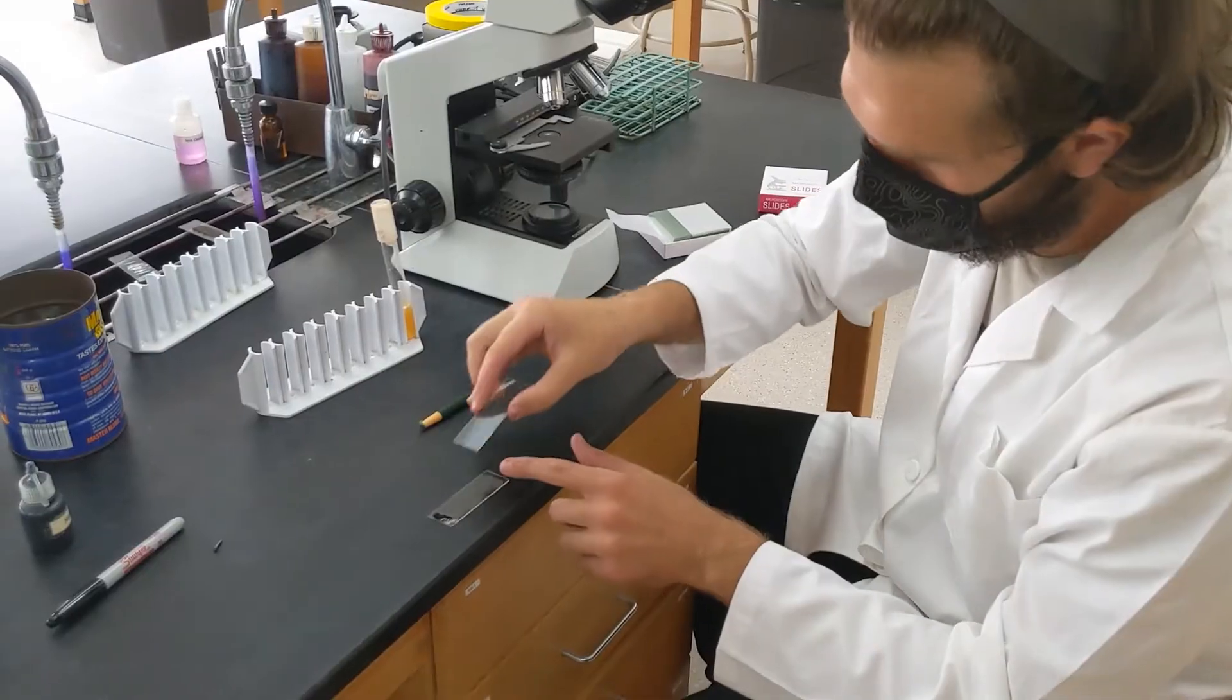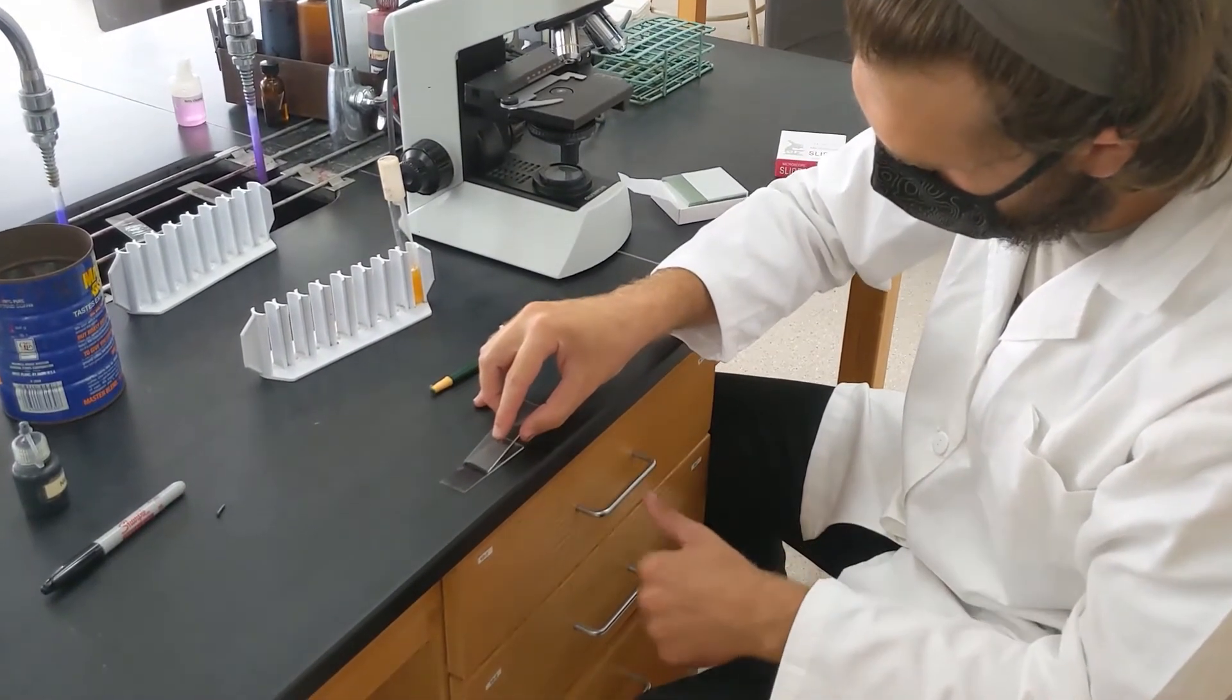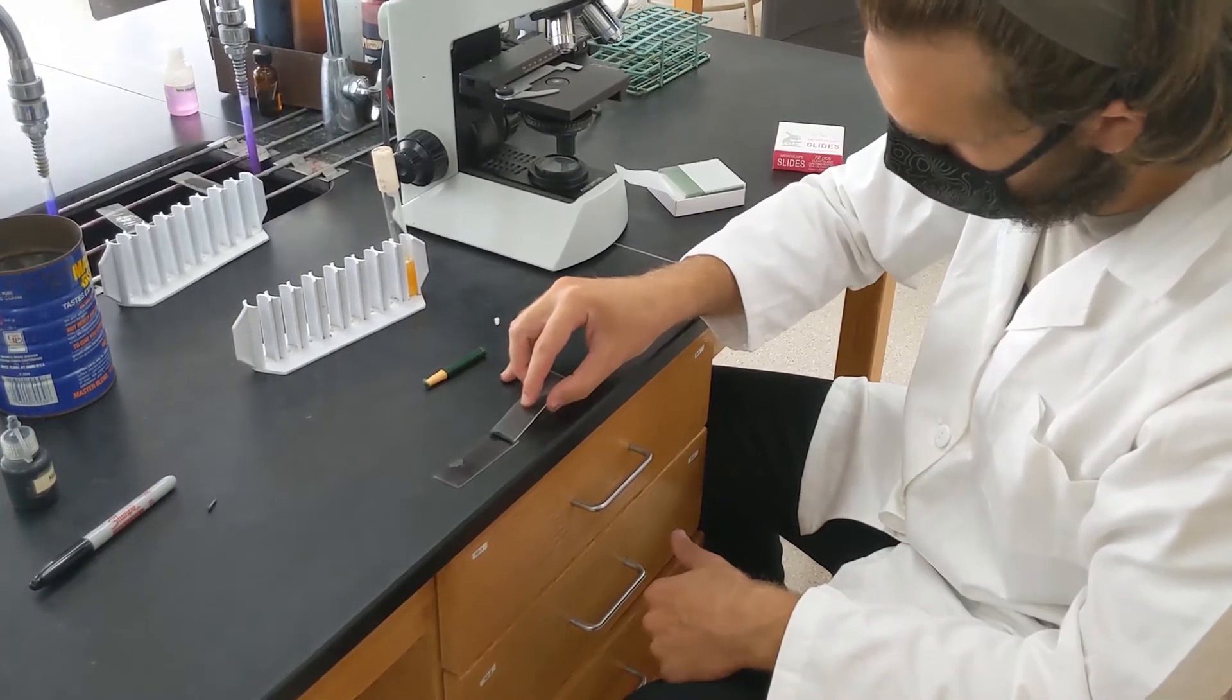Take another slide and then kind of drag it like this to spread it across the slide.